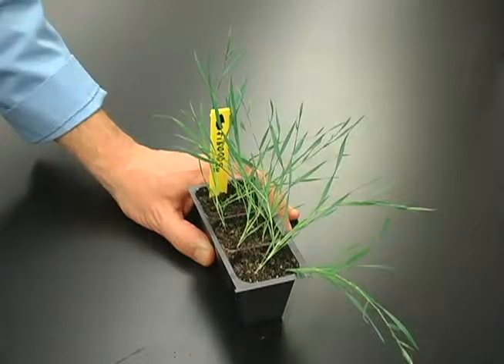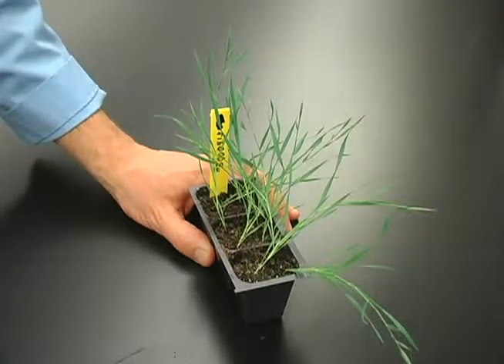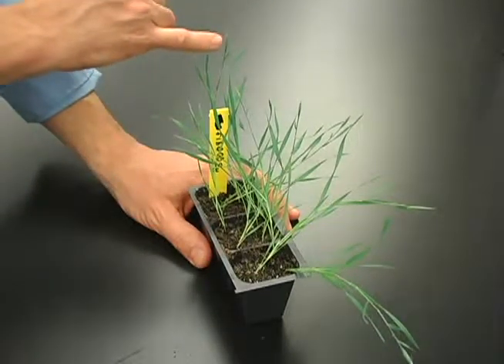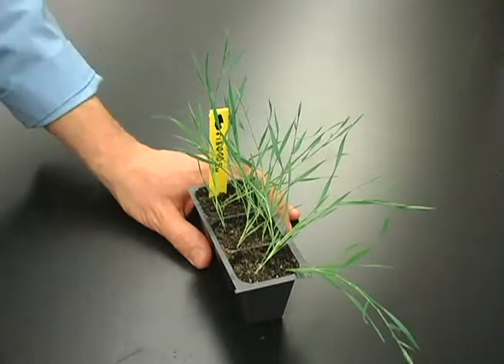The third screen should be performed when the plants have induced flowering. They'll initiate many branches, and you'll see there are multiple florets at the end of the main spikelet. For instance, here we see one spikelet that has 8 florets. In the third and final screen, you'll see many mutations that affect plant form and flowering time.